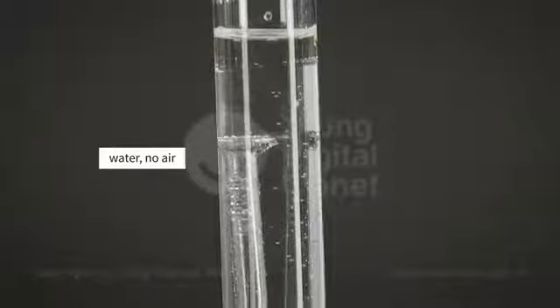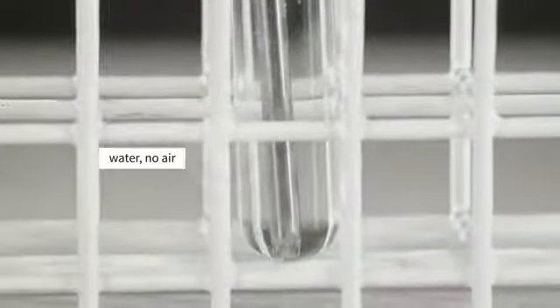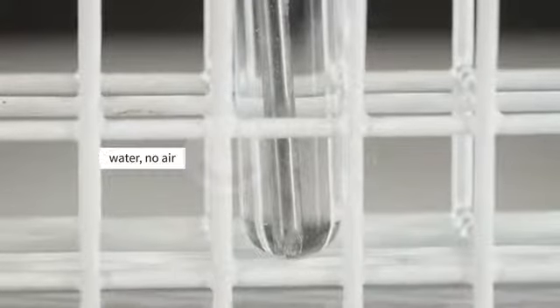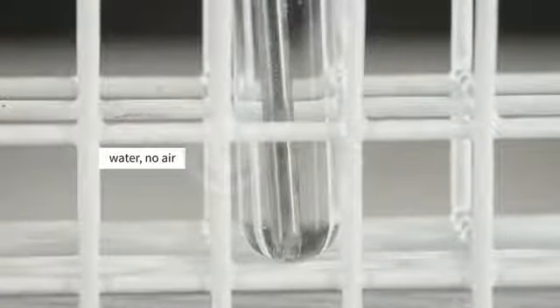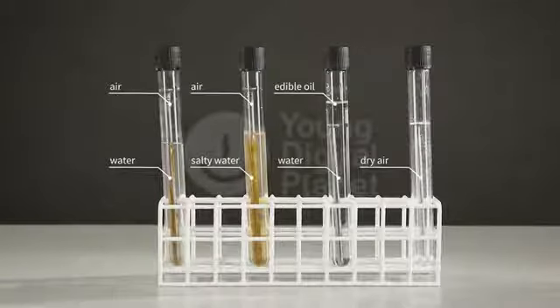However, no rust formed in the third and fourth test tubes. In the third test tube, the nail was in contact with water, but there was no access for air. In the fourth test tube, there was no water. It appears that air and water are needed for rusting to occur.